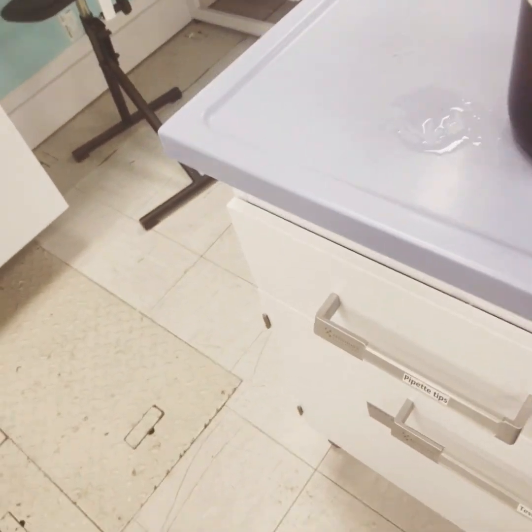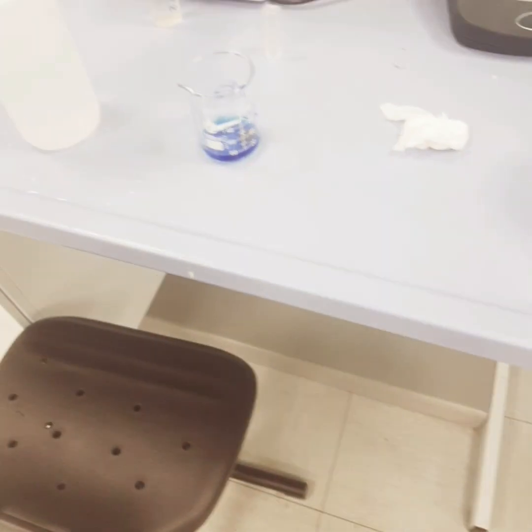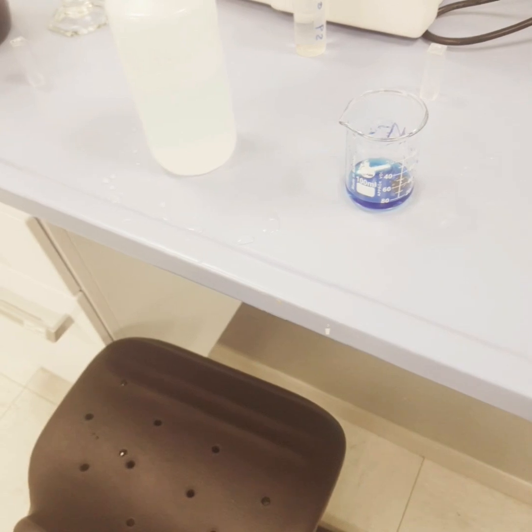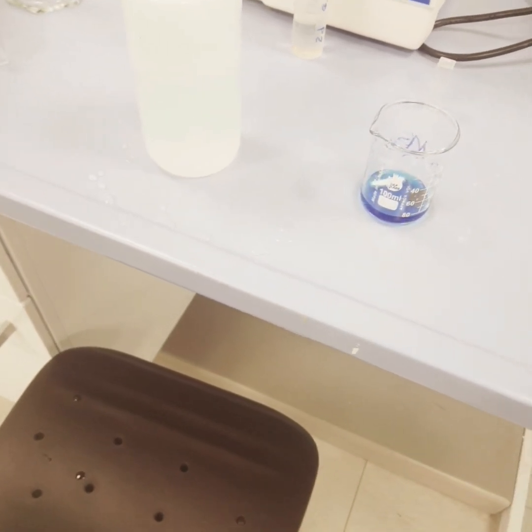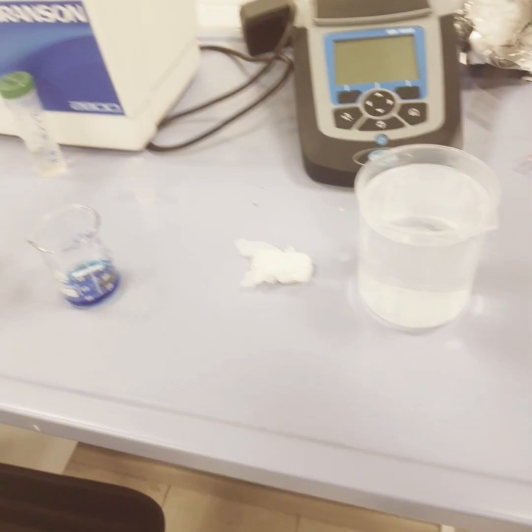Here we have the another scavenger which is tertiary butyl methyl ether and this is 1 ml added to the... sorry it is 1%, so 1% is 5 ml of that added to the 500 ml of the jar.